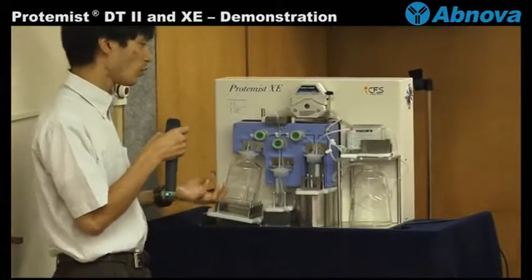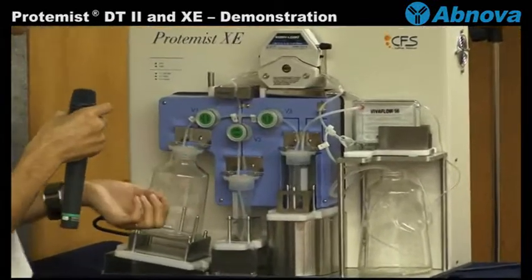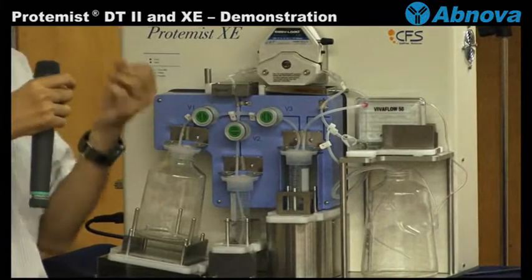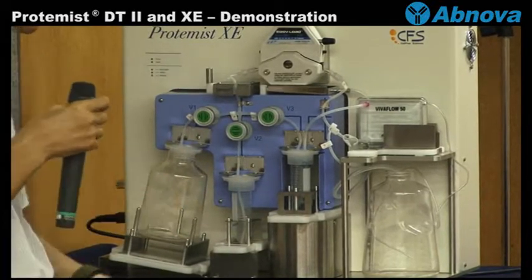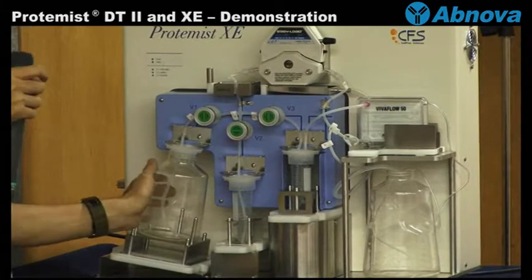And of course you need to prepare the translation reactions which contains wheat germ extract and translation buffer. And you also need to prepare translation buffer here.